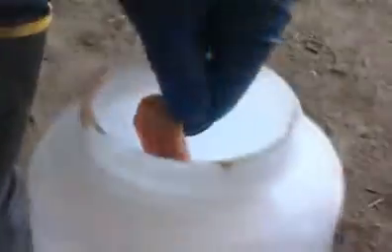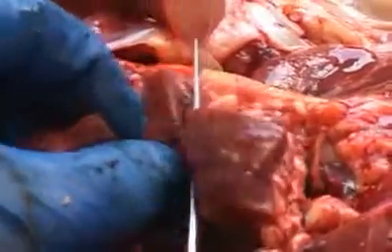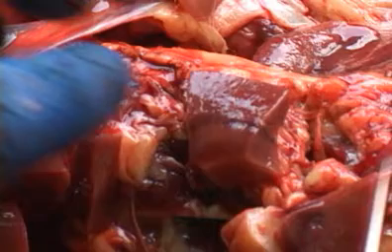During each detailed organ exam, tissues will be collected for histologic evaluation and microbiological testing. To collect a histology sample, use your knife to resect a small slice of tissue no more than 1 centimeter thick. Immediately place the tissue into the formalin jar for fixation.